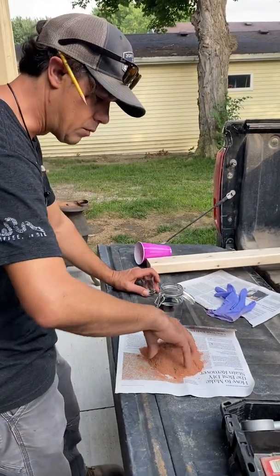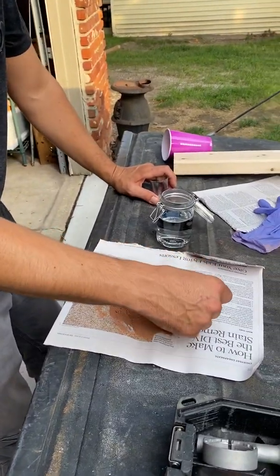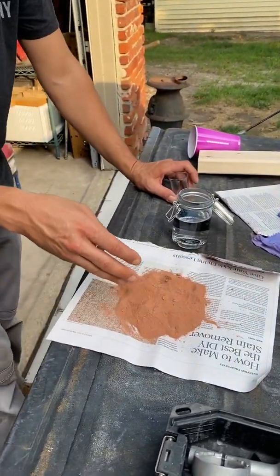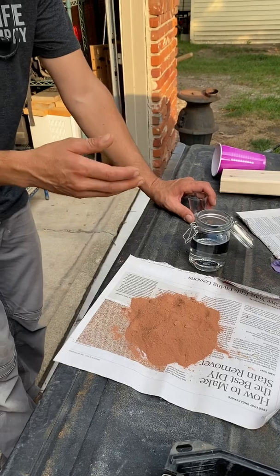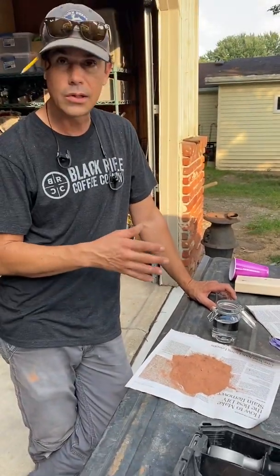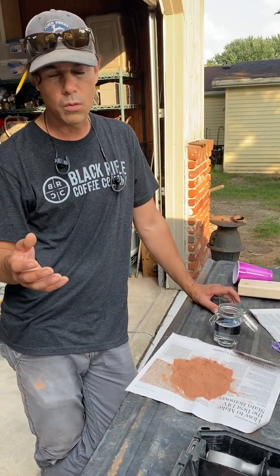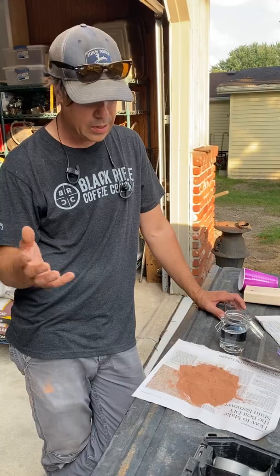We're just going to mix it up, make sure, like I said, it's uniform. We don't want any of this grass and stuff in there. But what we're going to do is we're going to take some, we're going to put it in here and shake it up. And because there's this classification of sand, silt, and clay, it gives us kind of an estimation of soil type. And from that, we can work on fertility issues, drainage, all kinds of things.